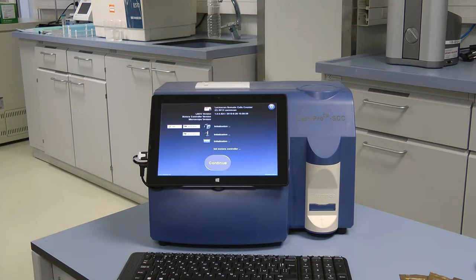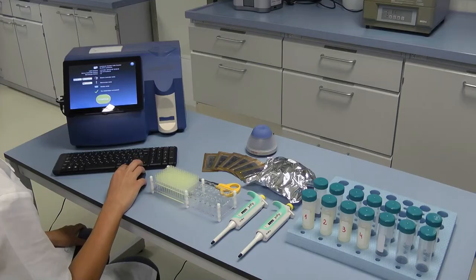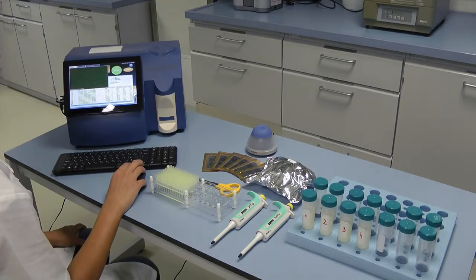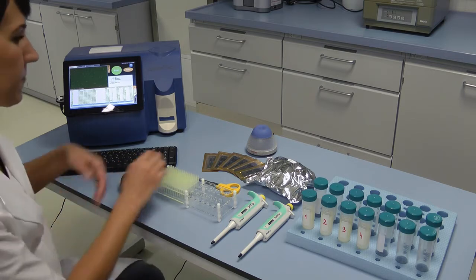Wait for a couple of seconds until everything is loaded and then press the button continue in order to proceed to the main display. The device is now fully switched on.